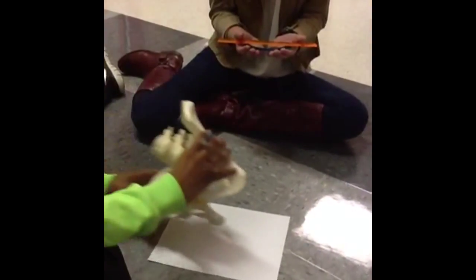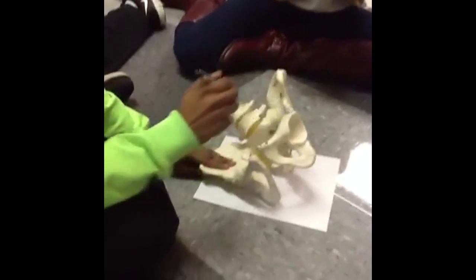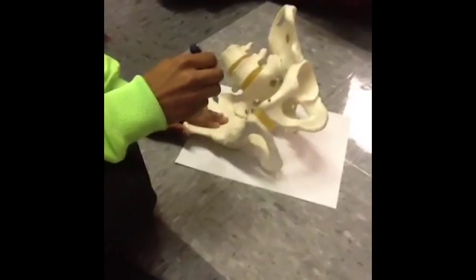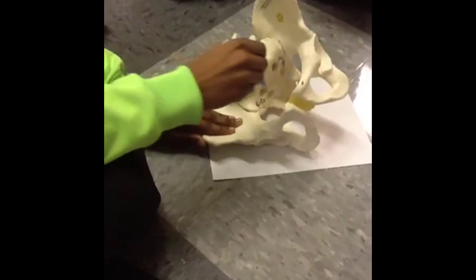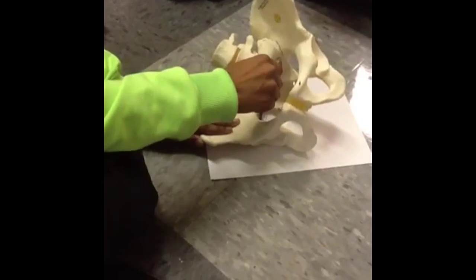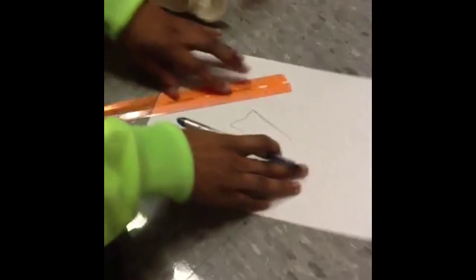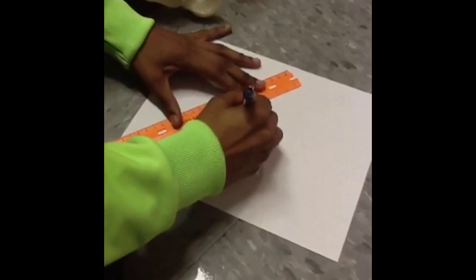The greater sciatic notch: place the pelvis posterior side down and turn it so that the greater sciatic notch is flat against a sheet of paper. Trace the angle of the notch onto the paper. Use a straight edge to extend the lines until they meet to form an angle. Use a protractor to measure the angle you have just drawn.